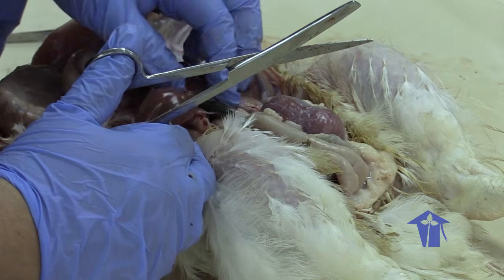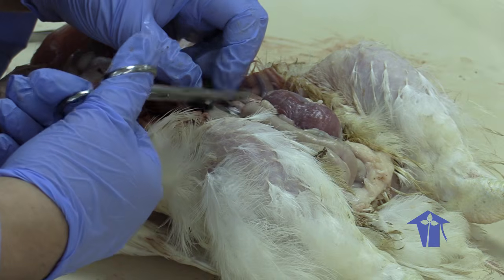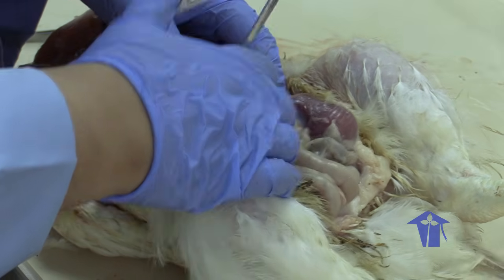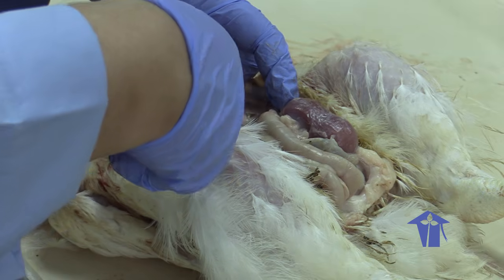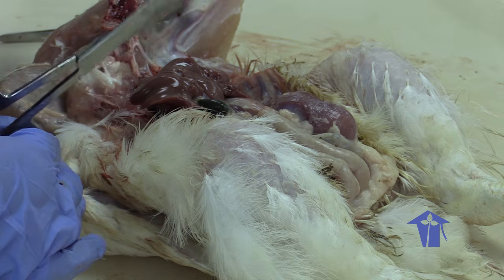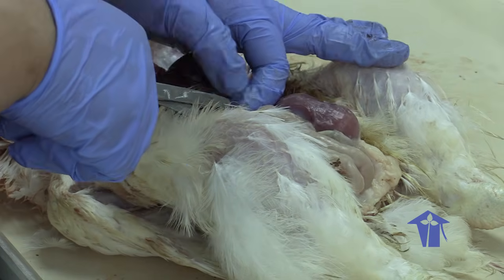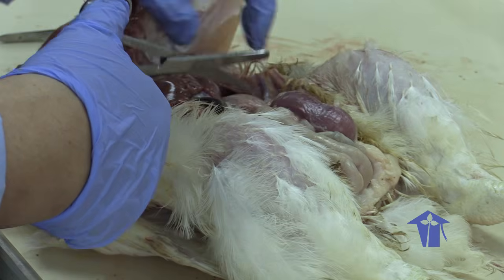So one thing that you won't get with a virtual dissection is the smell. It can be a bit forbidding. I mean, we're scientists, so there are certain things that we just deal with. So one strategy when you're doing dissections and the smell disturbs you, you can actually put a little bit of Vicks just at the opening of your nose. So you will get the smell of Vicks overwhelming the smell of what you're cutting open.